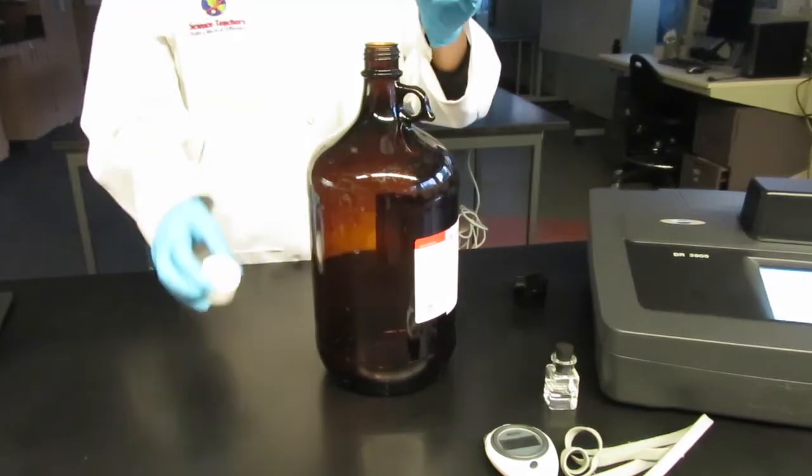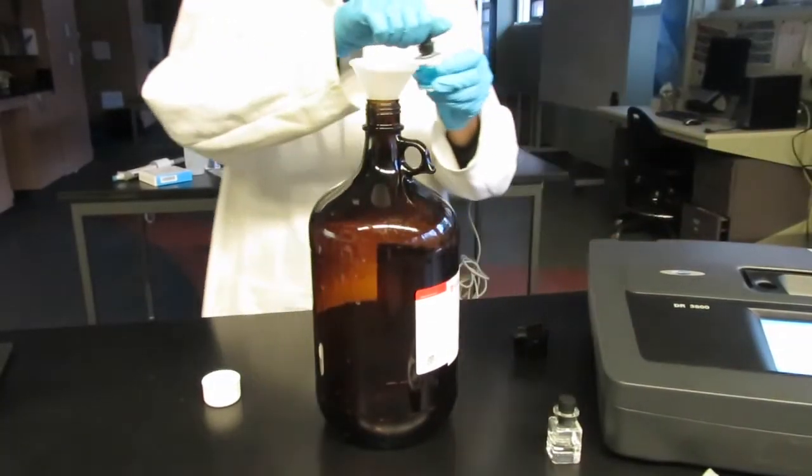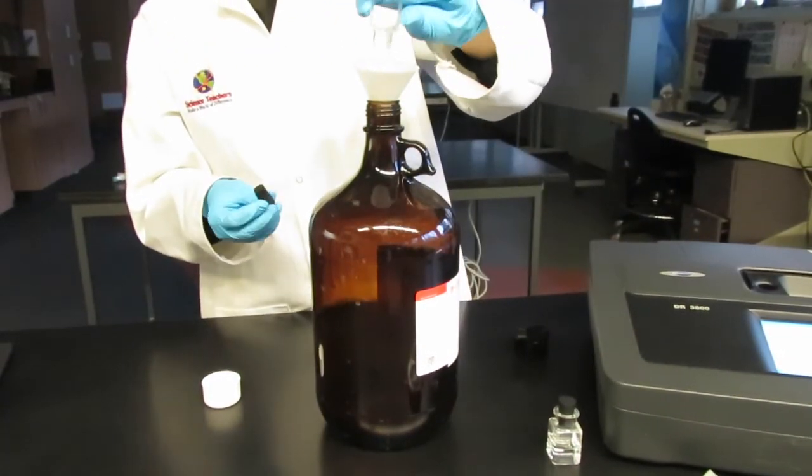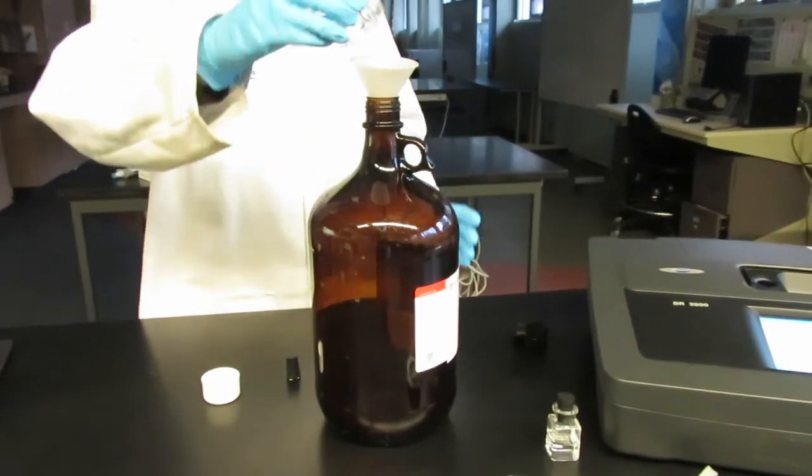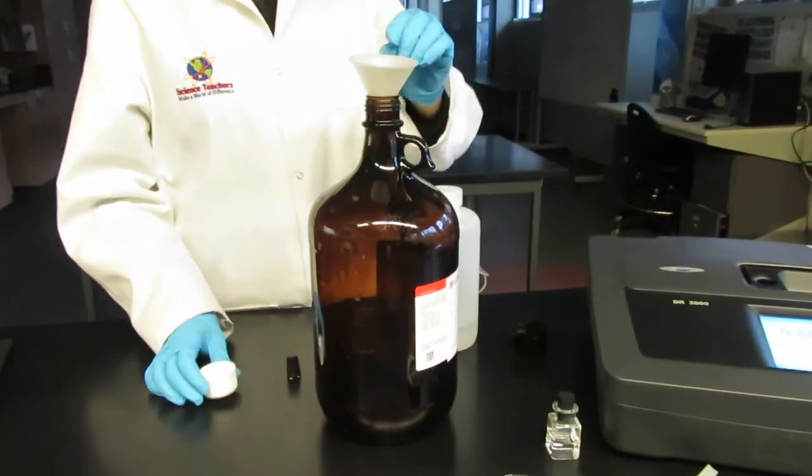We never pour the contents down the sink as this is hazardous waste. We use labeled amber jars to dispose of all of our contents. Be sure to rinse the glassware as well.